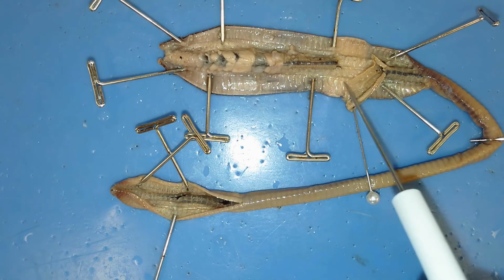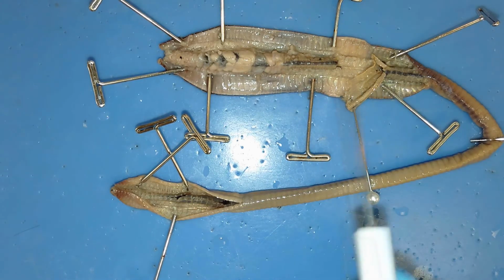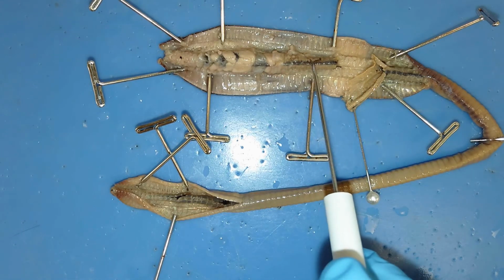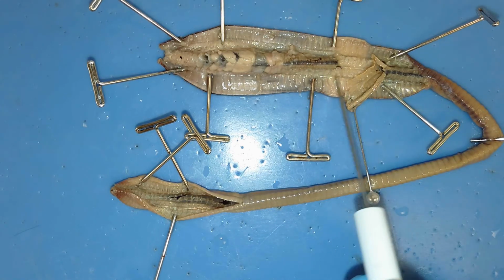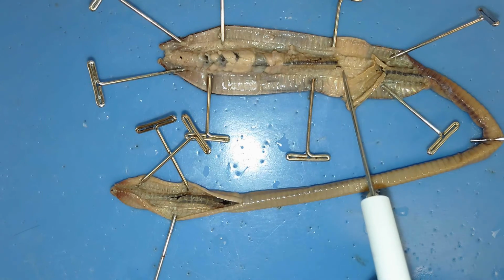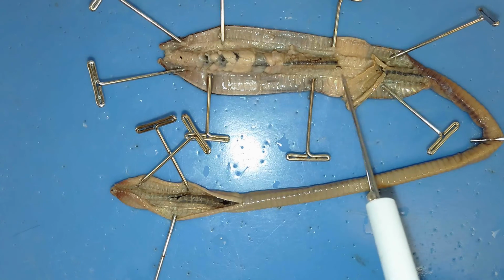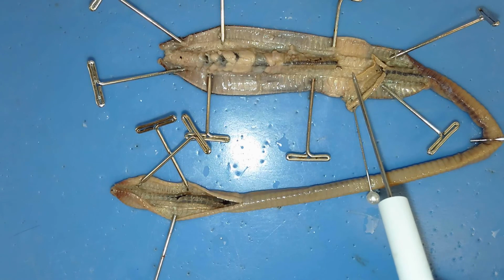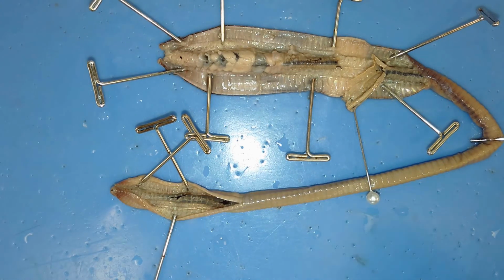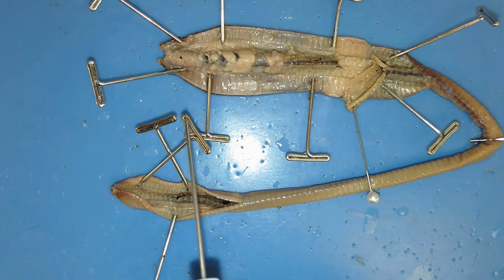So it's located ventrally because any predator attacks that occur, such as a bird, are coming from the top down. So it has this fairly thick intestinal tract as well as the cuticle to protect it from predators. This is a fairly expensive structure to make energetically, fairly expensive to make and maintain, so it requires as much protection as possible. So that's the anatomy of an earthworm in 16 minutes.